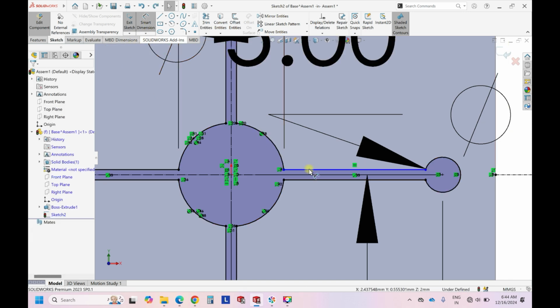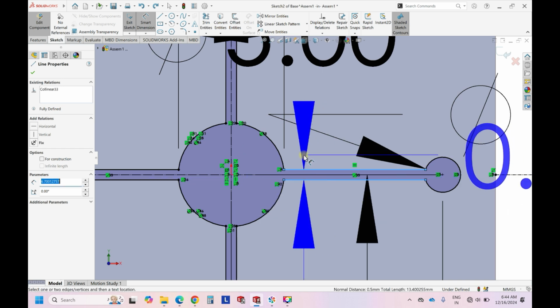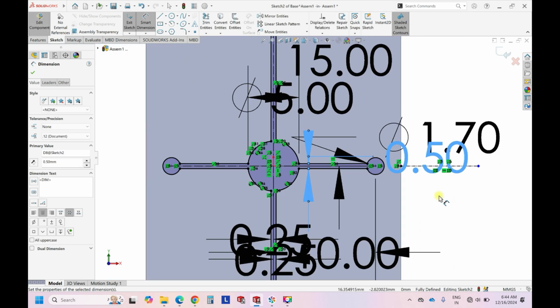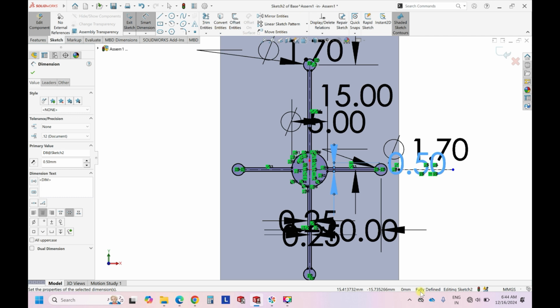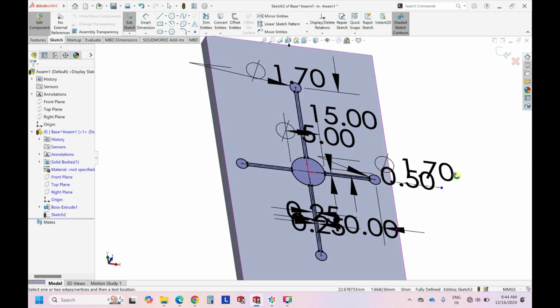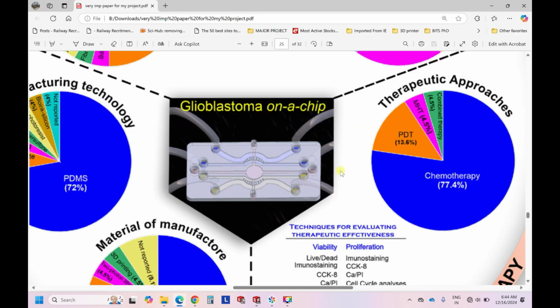Okay, so simple, use the smart dimension, just give it 0.5. Once you have given it, see all the sketch is black and it is showing us fully defined here. So this is what is needed in all the designs. Okay, so now this is done. So it means that the inner part is done, and now let's do this one side part.